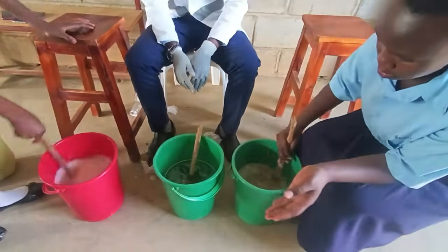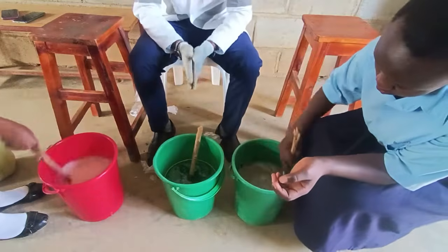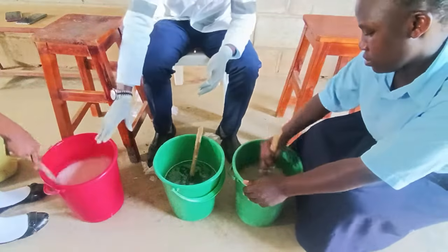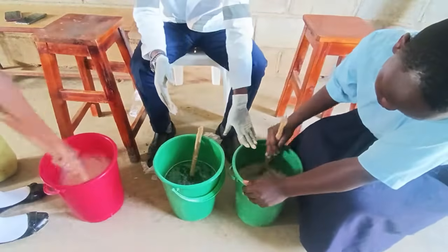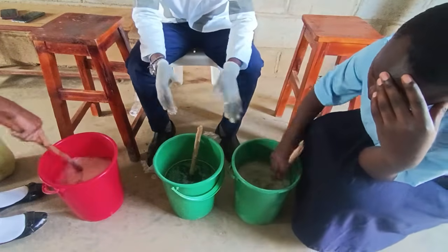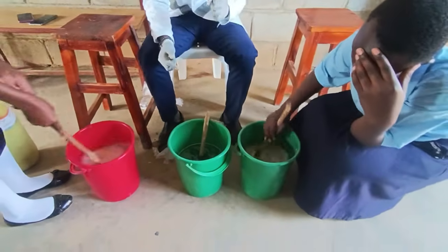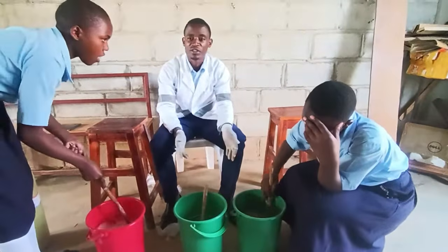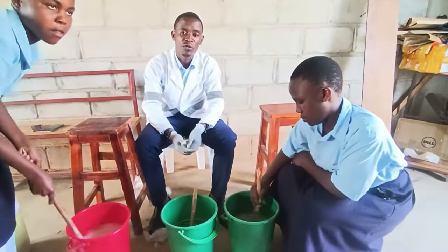So at this point, we have our caustic soda, 0.5 kgs, that is half a kilogram, dissolved in 5 liters. Then here we have half a kg of chlorine, and then in this bucket, we are having 2 things, the STP and then the magadi salt. All these have been dissolved in 5 liters, and we're going to keep these solutions for the next 24 hours. So tomorrow at this time, we shall be back to wind up with our process of making JIK. Let's meet tomorrow after 24 hours.